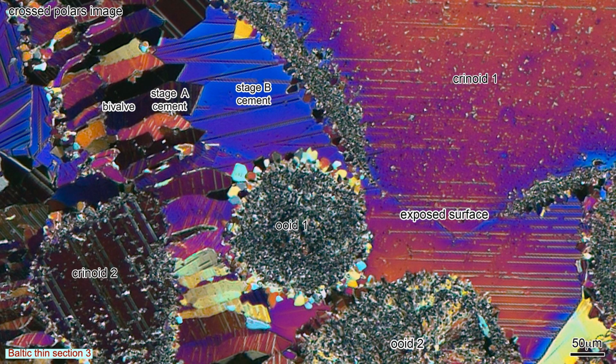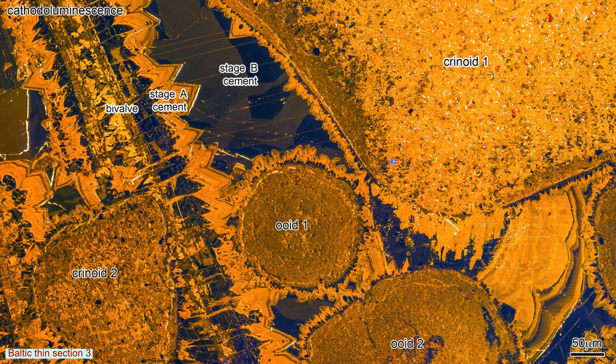The cross-polars image shows the bivalve's calcite crystals and their attached intergranular cement have the same birefringence colours. Similarly, crinoid 1 and its attached intergranular cement crystal have the same birefringence colour, because their cements are epitaxially attached to their substrates. The various components of this rock, differentiated on this CL image, are used to produce a series of sketches showing its diagenetic development.